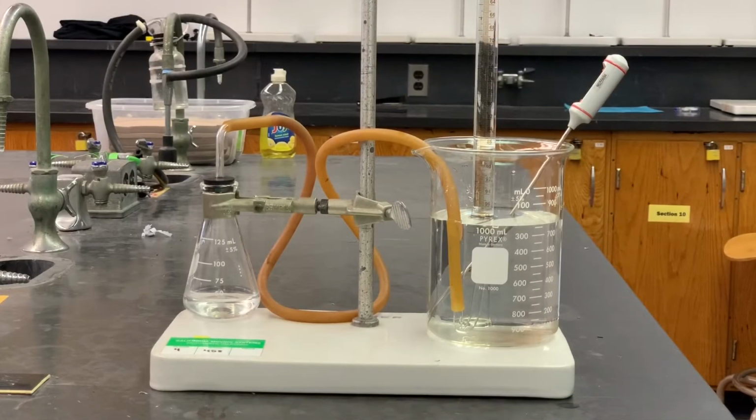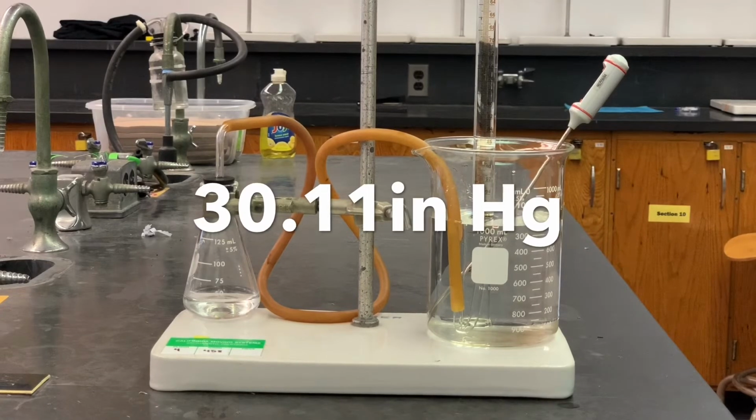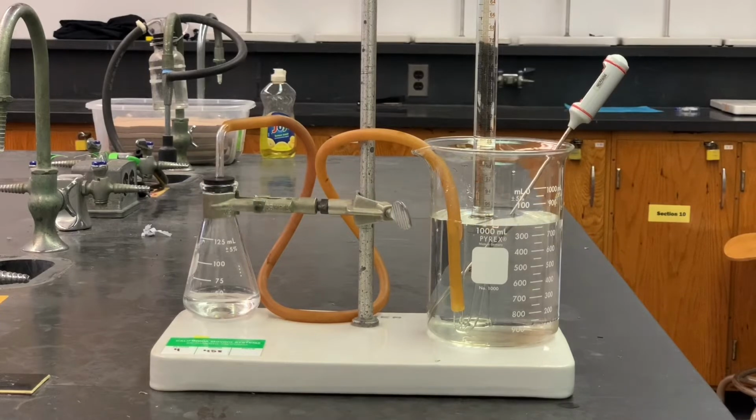Here is the fully assembled apparatus. The eudiometer is completely full of water, and the hydrochloric acid is already in the flask. Two things you should know before we begin. The temperature of the water, which we'll record as room temperature, is 20.5 degrees Celsius. And the barometric pressure in the room is 30.11 inches of mercury.